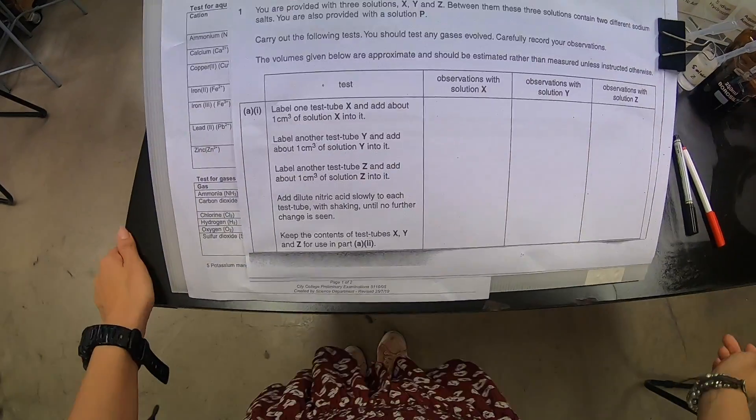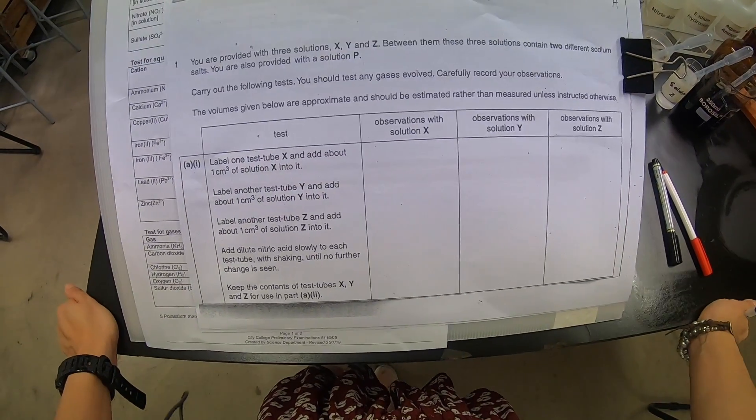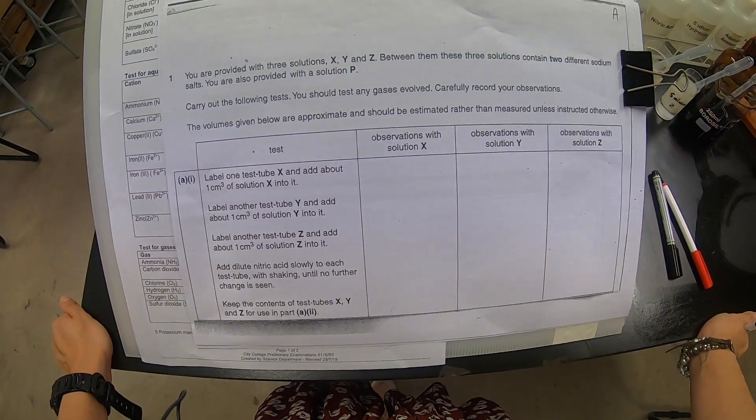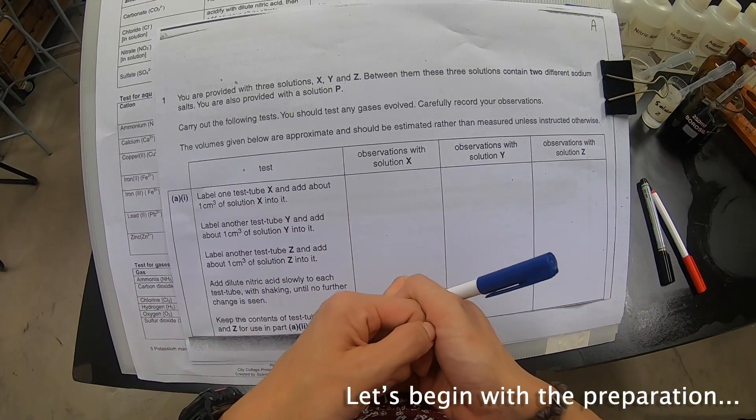Today we're going to do the 2015 GCE O-level practical paper. Let's begin the preparation.